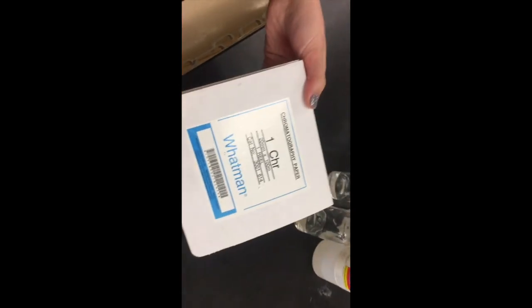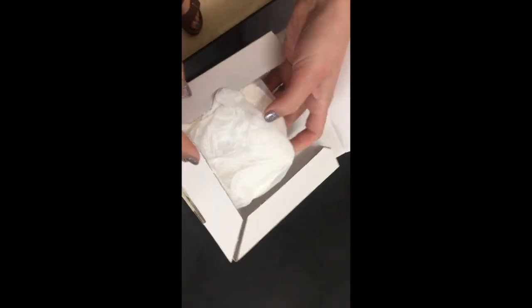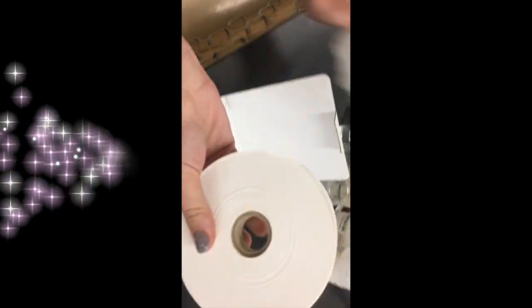Next, you're going to need a roll of chromatography paper. This one here costs $45 on Amazon. Ta-da!